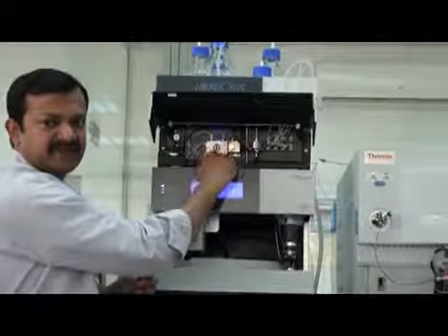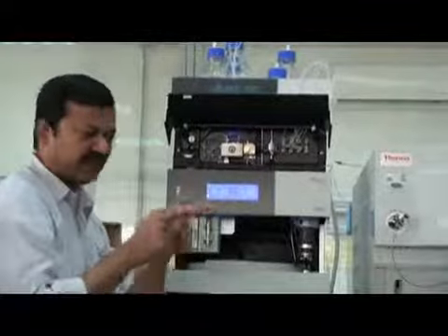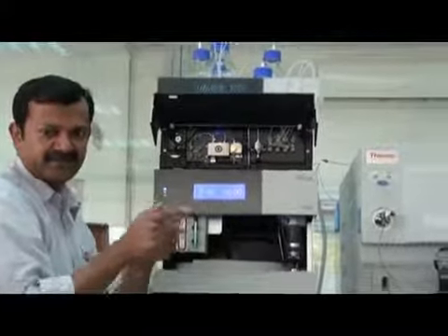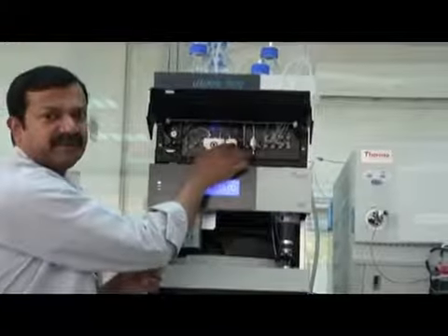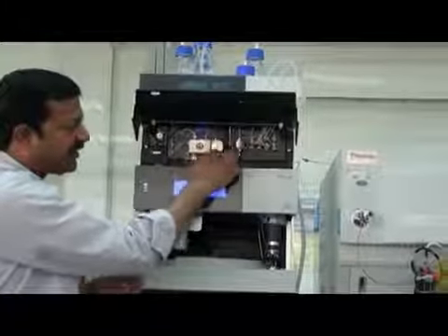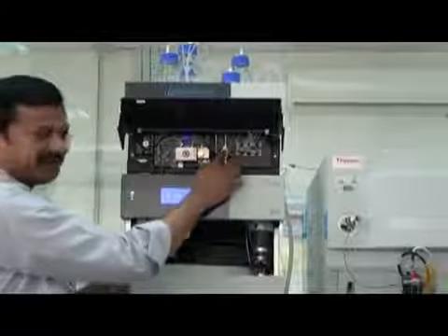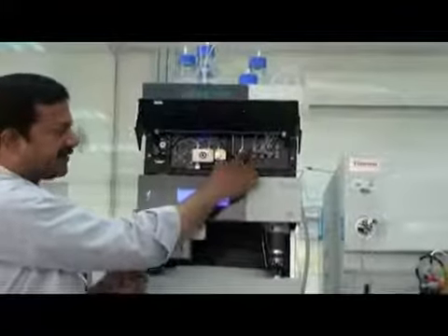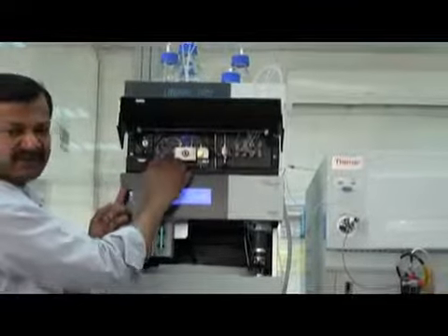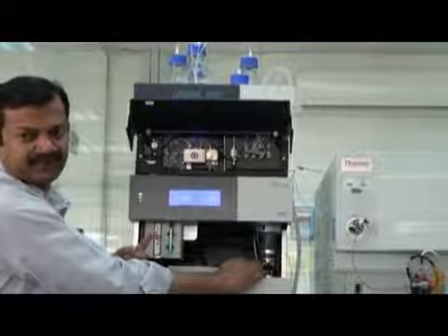This is the piston. The piston and the seals are here, moving like this inside. From here it is pumping. This is the pump station. If you open the drain, it will go to the drain. If you close the drain, it will go to the static mixer. Here the compounds are mixed, whatever concentration you give, and then it comes here. So first is degassing, then mixing.